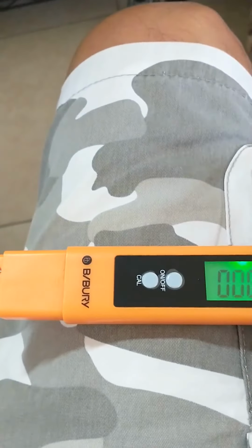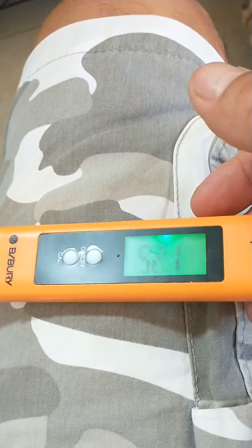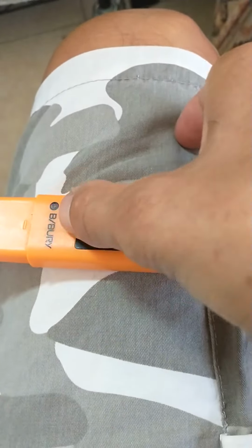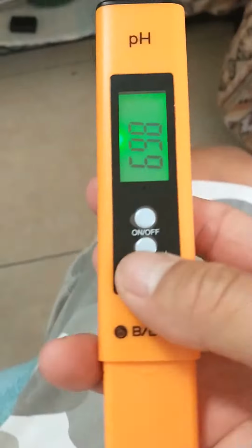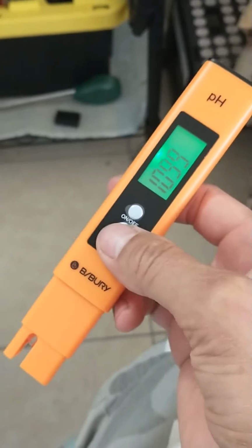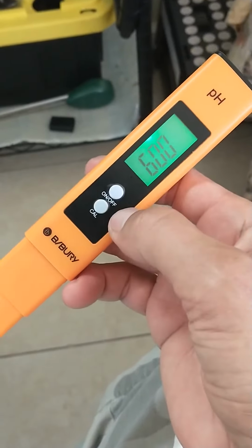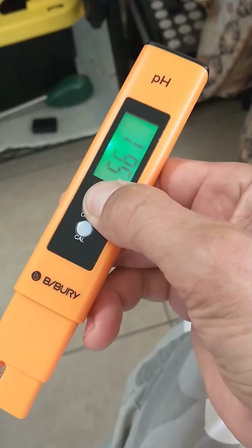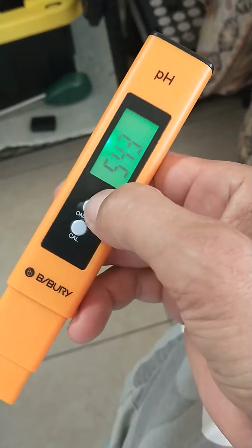Now this is normal. Oh, now it wants to go to zero. There you go. See? It's just going crazy, bro. Okay, still just going nuts. Alright, so turn it off. Wait, turn it off.